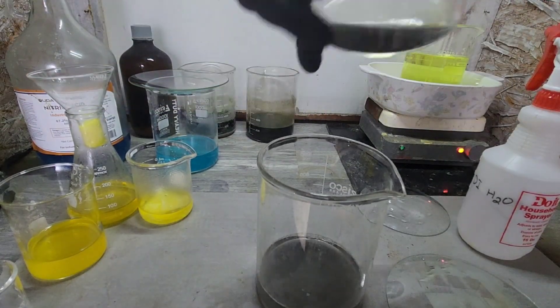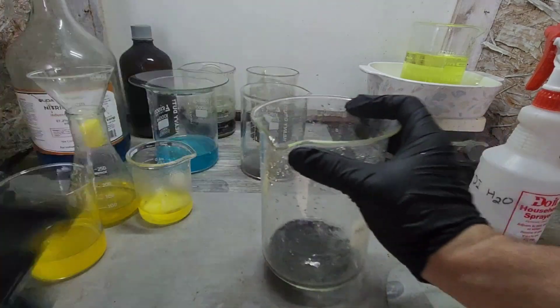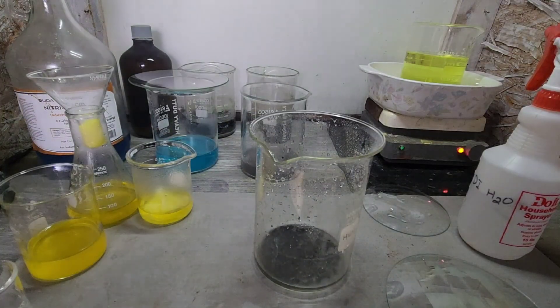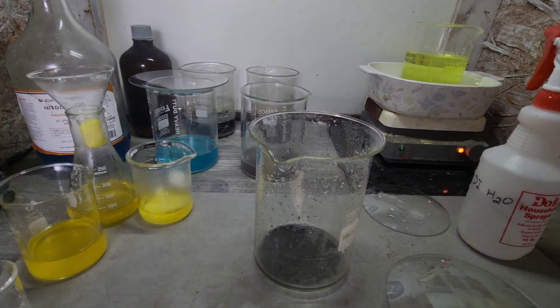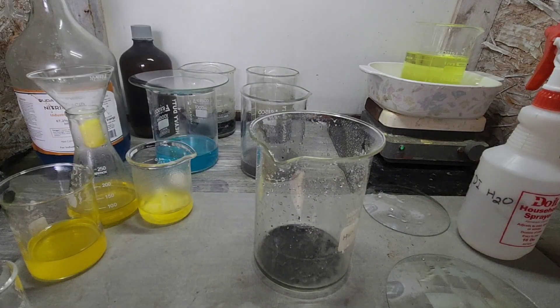So that's my waste, my aluminum waste. I'm not putting that in any other stock pots, I'm going to just take care of that separately. Yeah, there's no sense mixing it, getting that aluminum all over the place.